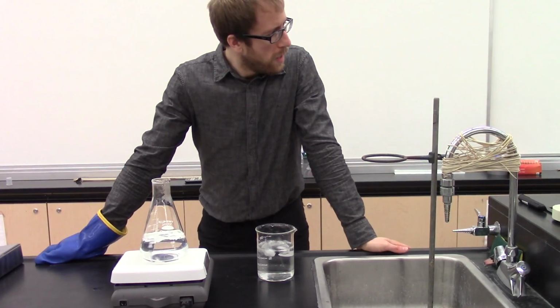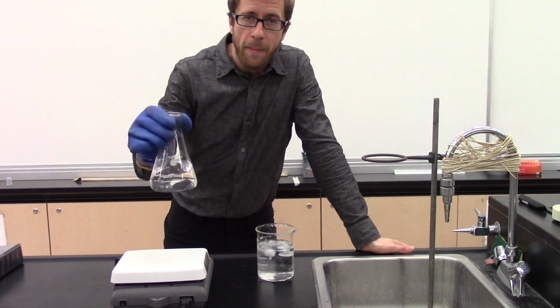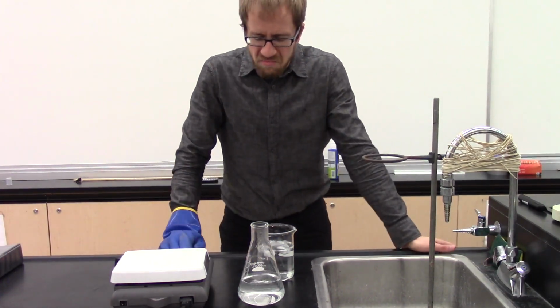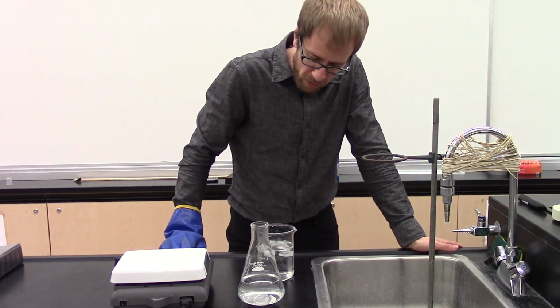Hello class. Here I have a flask of boiling water. I'm going to take this boiling water and pull it off of the hot plate here. We're going to give it a second or two to cool down a little bit. I want it to stop boiling.